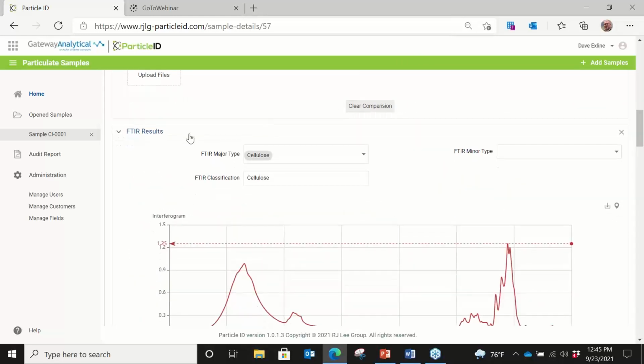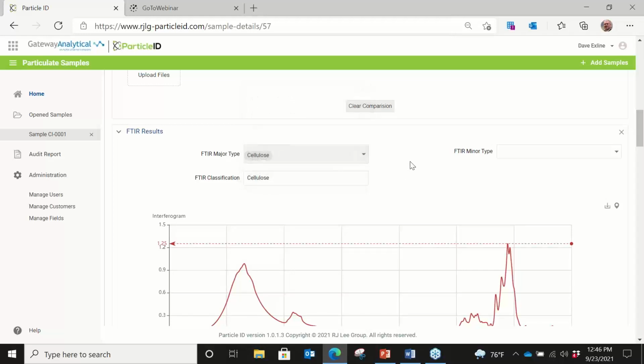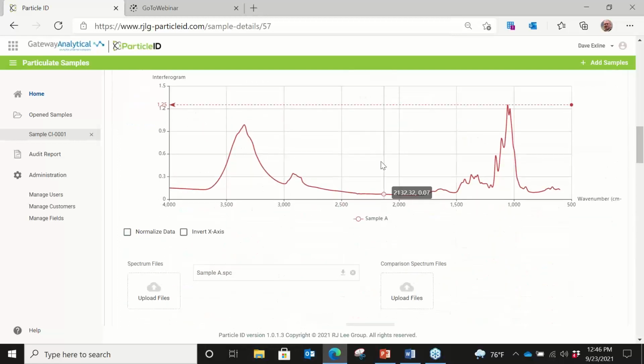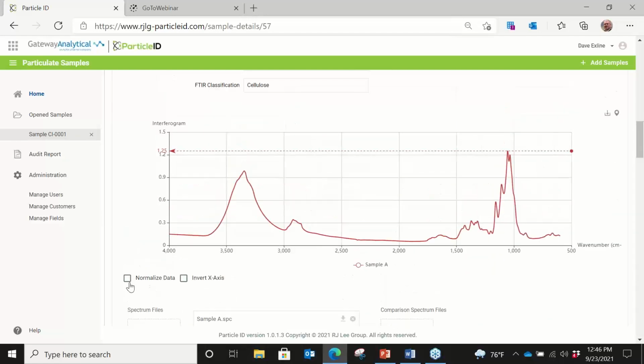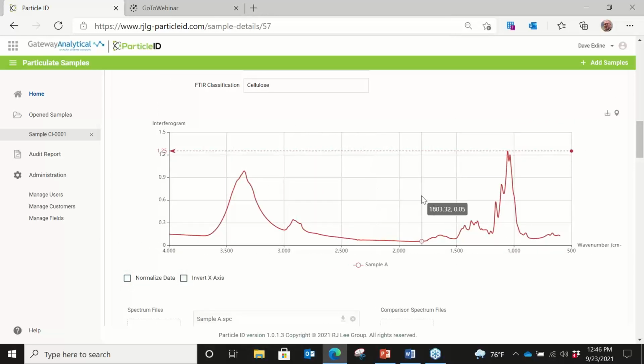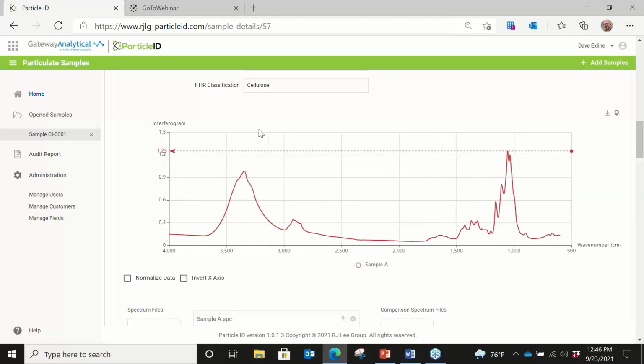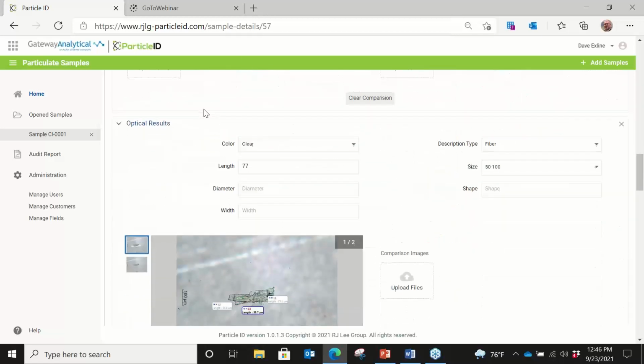We also have things like, here's an FTIR, for example, where we can identify what classification it fits in. So later we can search all cellulose particles, all classifications as cotton or cellulose. But here's an example of a spectrum. And again, it allows us to normalize the data. We can invert the axis. We can zoom in on the data and move it around and look at it, and we can just come back to it. And so that's an example of the FTIR data.